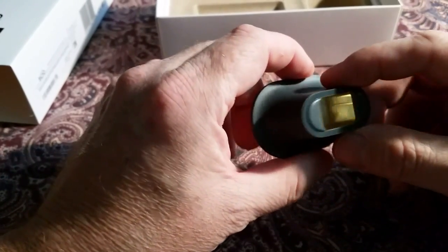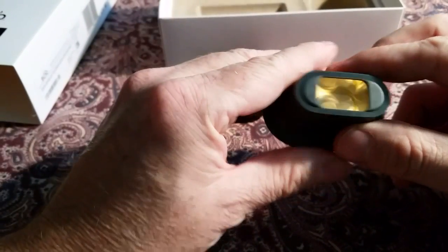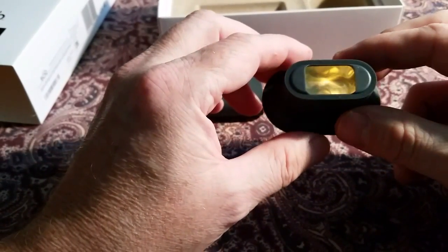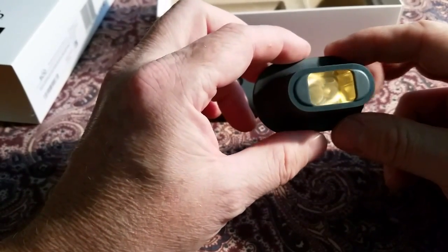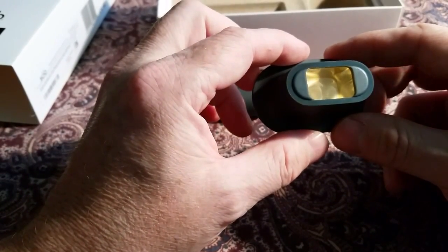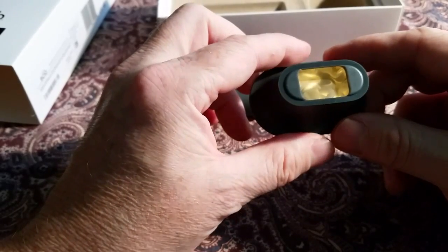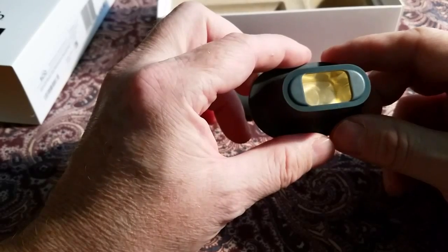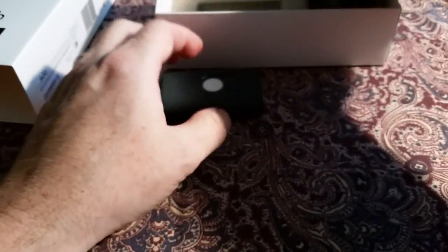The shiny part inside here is something special and we're not supposed to get it wet. I would recommend not breathing on it. Instead, use a lens cleaner sold at camera shops — blow, and maybe brush lightly, though more blowing than brushing.